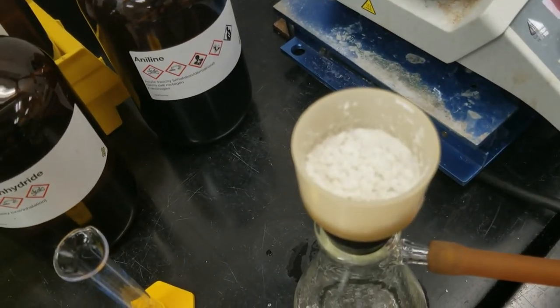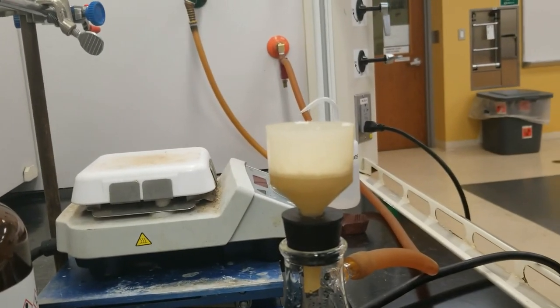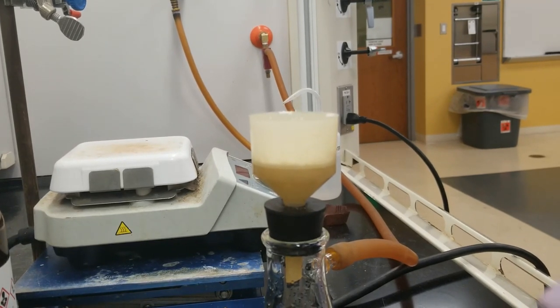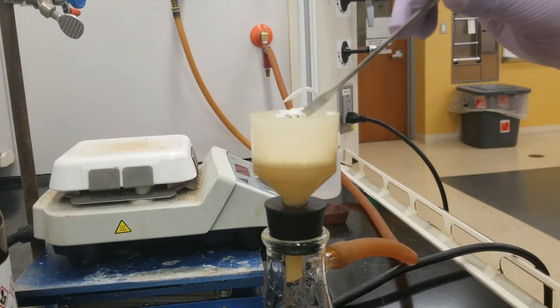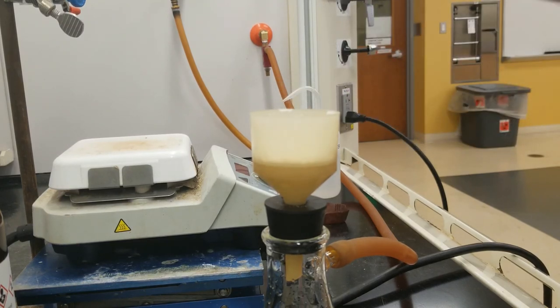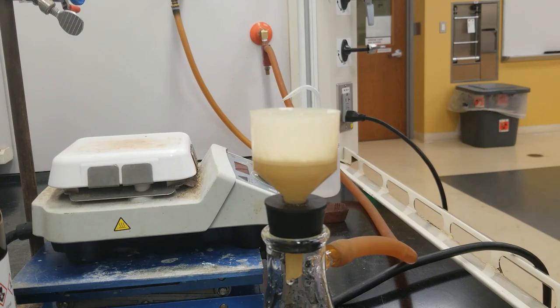Now that I've crushed those up, they're going to continue drying for the next 20 minutes. Once these crystals are so dry that I can pick them up and they don't stick to my spatula at all, I'll know that they're dry. Then I can go ahead and collect IR, melting point, and mass data for you guys to analyze. Thank you very much for watching.